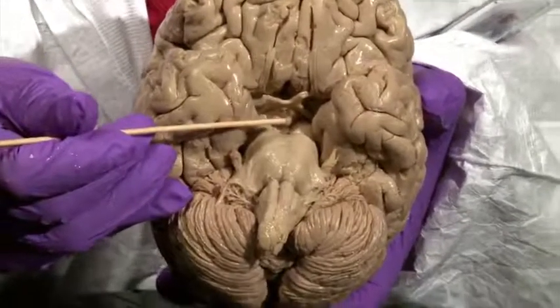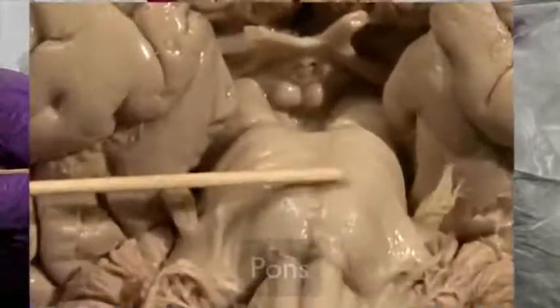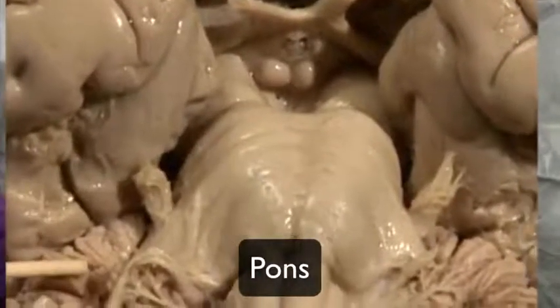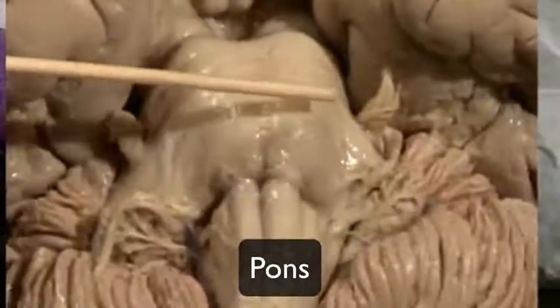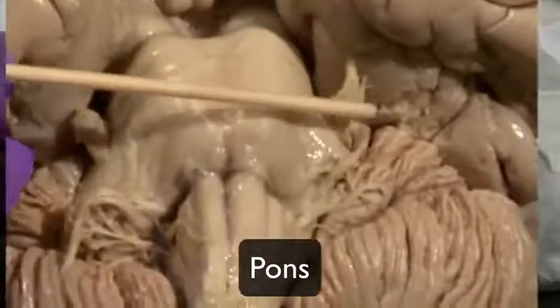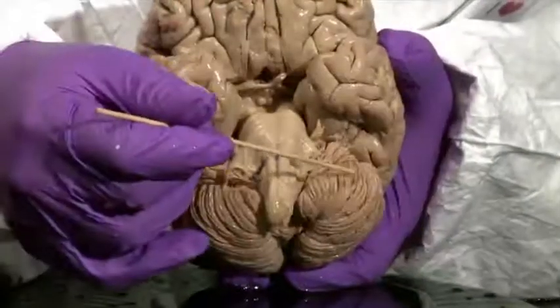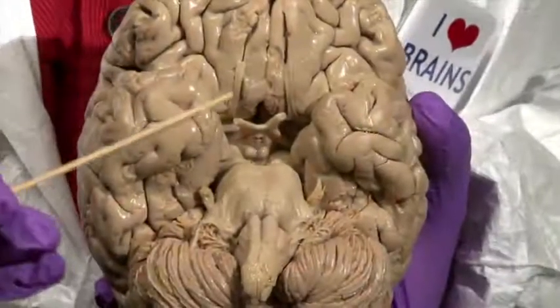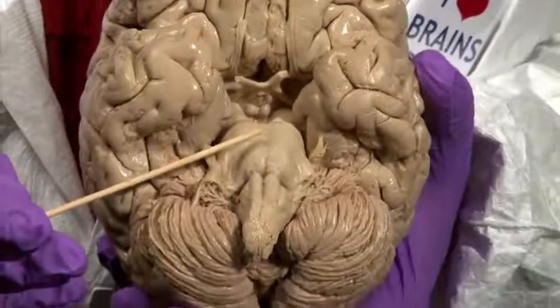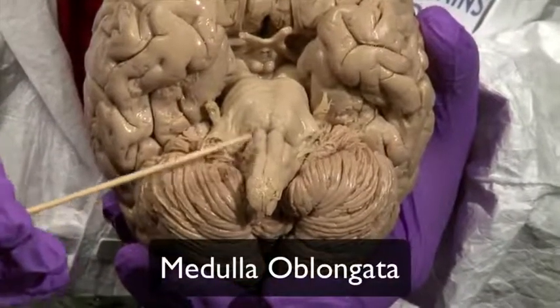Now, just inferior to the cerebral peduncles, as we see them here in the midbrain, is the pons and the cerebellum. The pons extends out laterally, again another massive bundle of white matter connecting the brainstem to the cerebellum. And just inferior to the pons, we have the medulla oblongata, or the medulla for short.